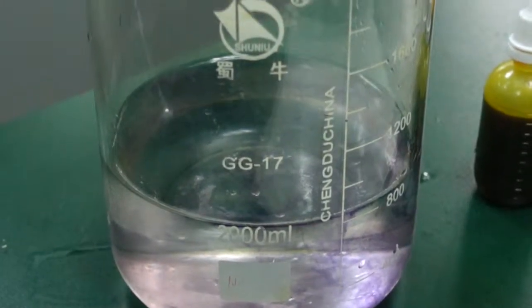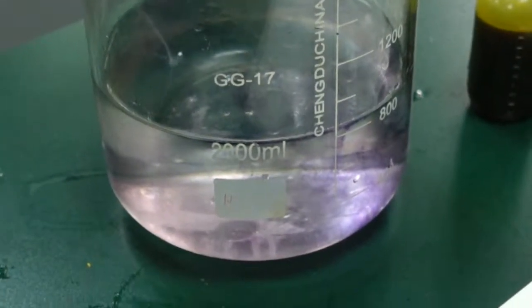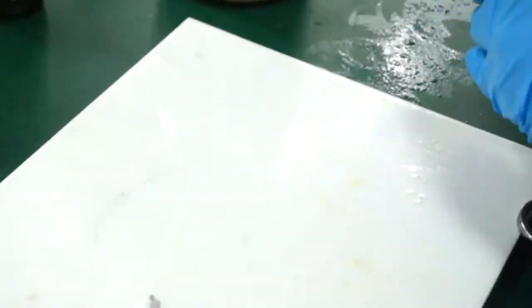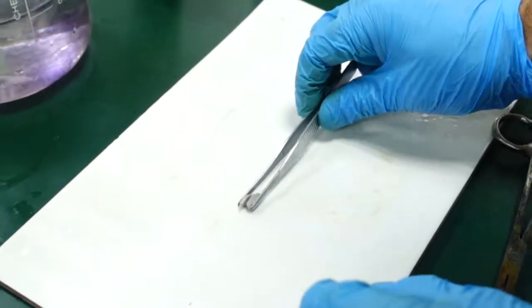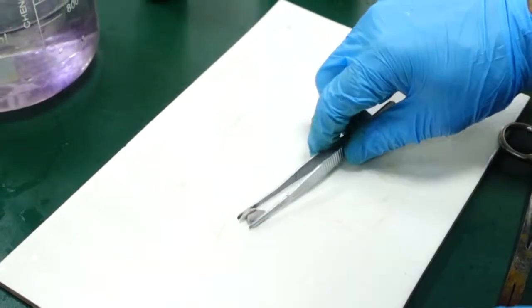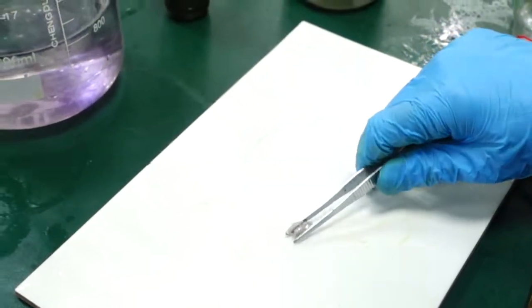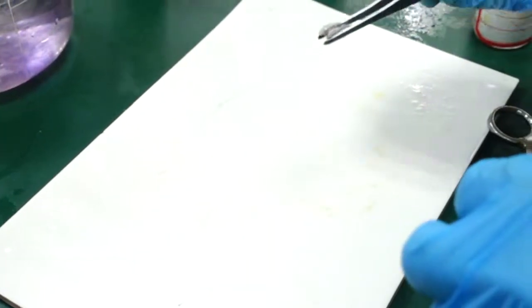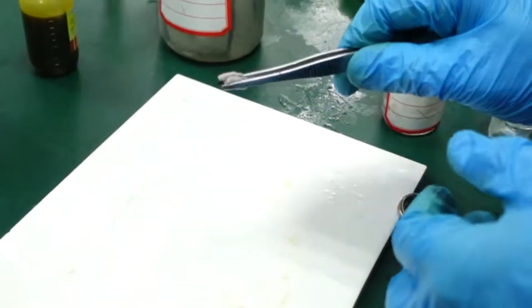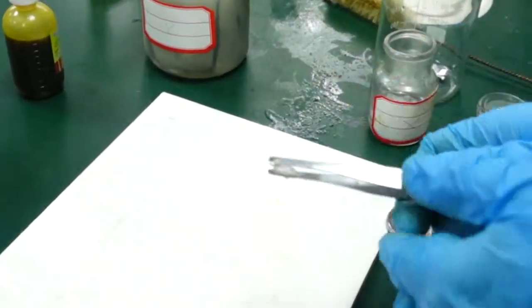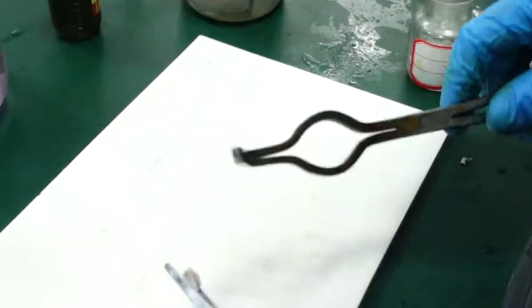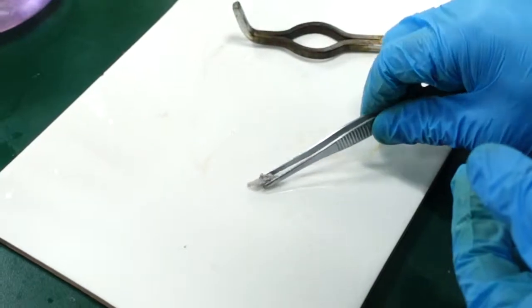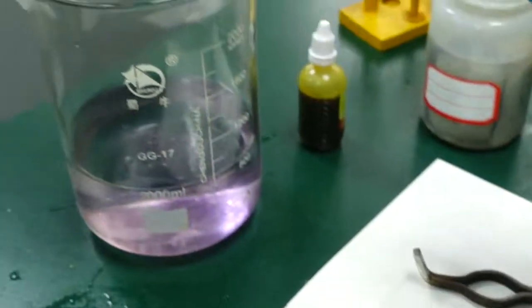See if I can make a big piece. All the pieces are small, so I want to make them together into a bigger piece. Purple! So has it gone acidic or alkaline? Alkaline! All right, let's just make sure that's not stuck. Good, hopefully that will stick together. Ready?